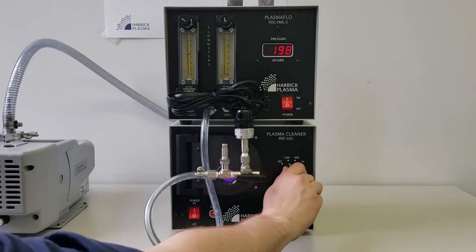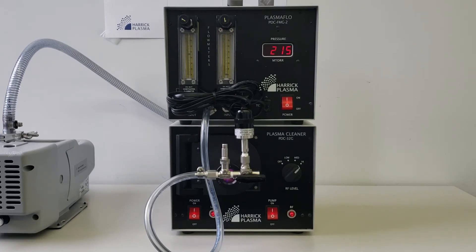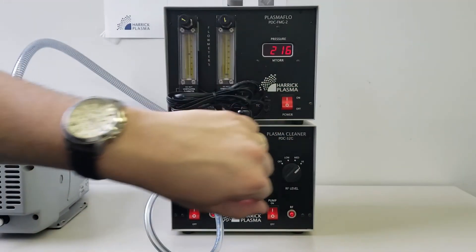Switch the RF power to high. You should quickly observe plasma ignition in your chamber. Start timing your plasma treatment when you see the purple glow.